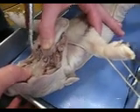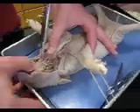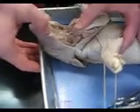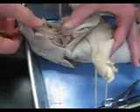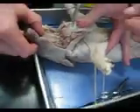You guys want to see it? Okay. This is hard palate, soft palate. Hard, soft. Of course, you can see the teeth there. Yeah, you can feel the teeth — they're pretty sharp, aren't they? Yeah. Tongue. Taste buds along the side, right here. Yeah. Through there.